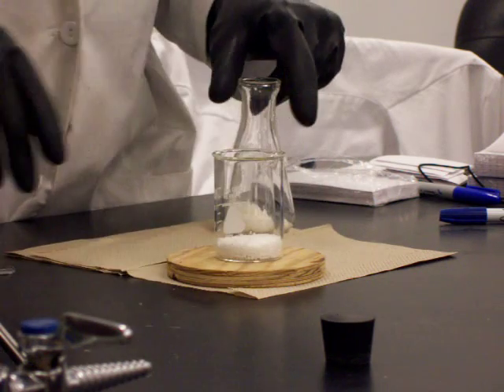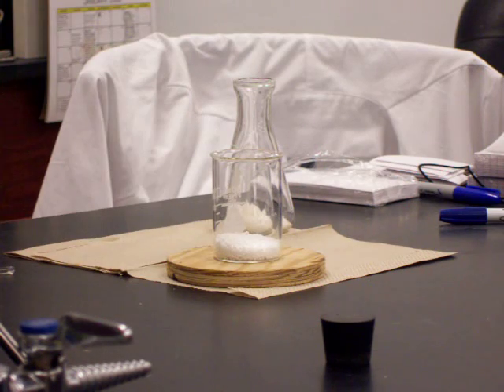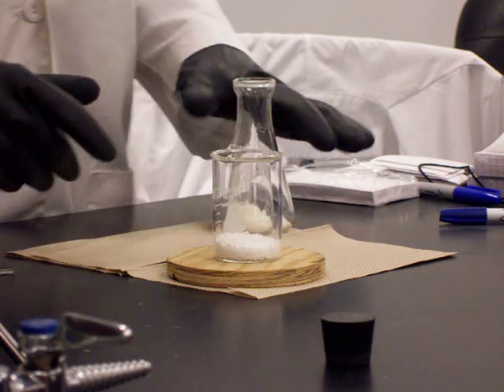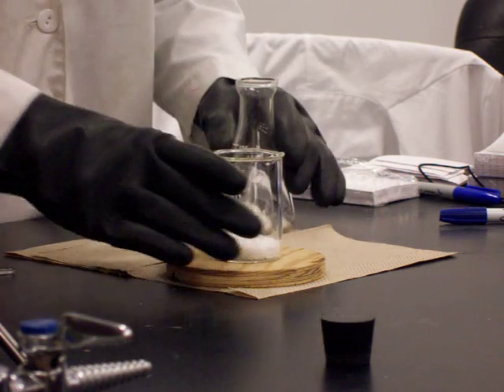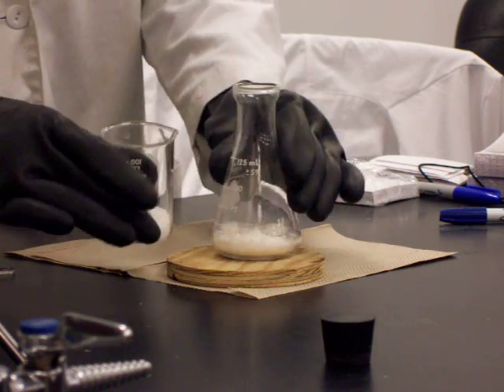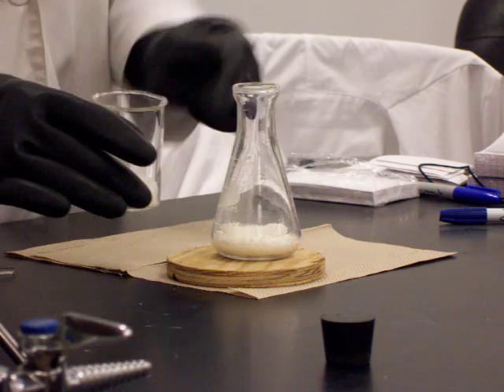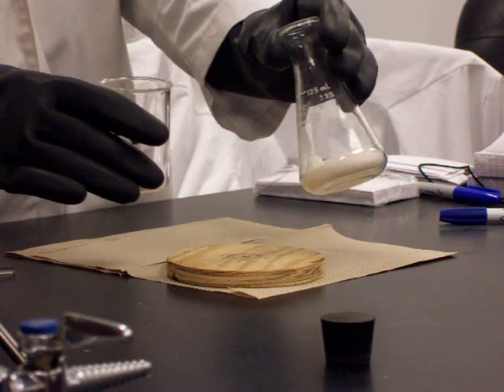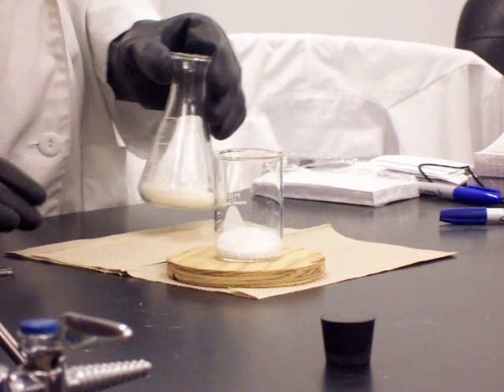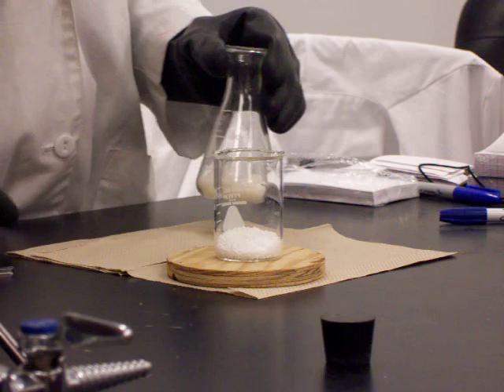The other chemical I have here is in pellet form — this is ammonium nitrate, the NH4NO3 from the reaction. When I take these two — ammonium nitrate and barium hydroxide — one is the flaky one inside the flask, and the other is the granular one inside the beaker. They are both in the reaction equation.